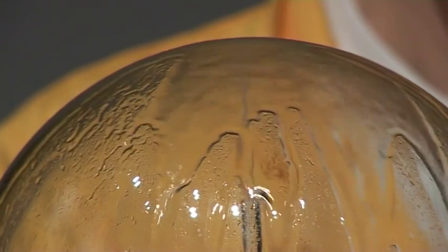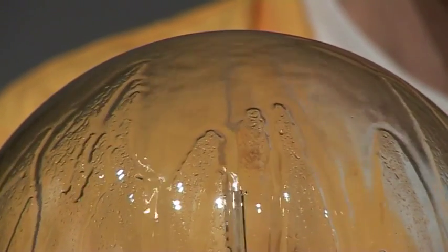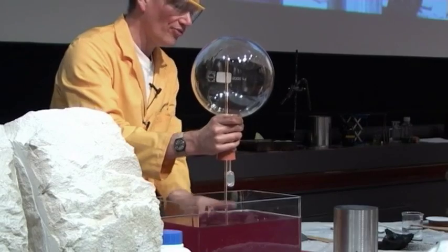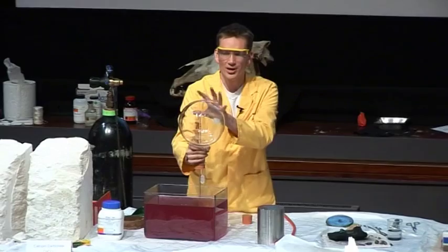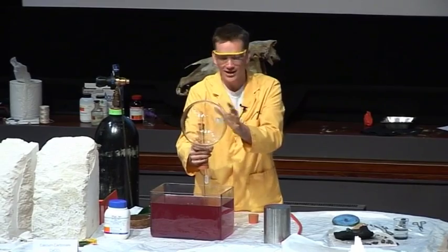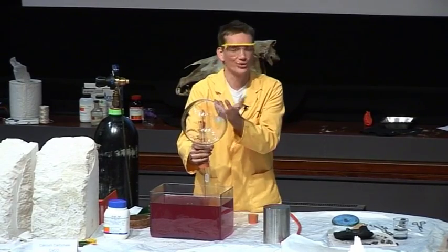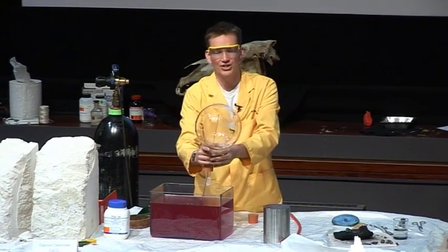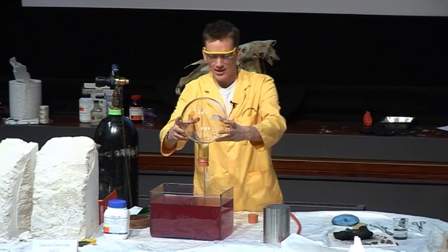Now, as it dissolves, this reduces the pressure inside the flask, which means that more of the water is forced up the tube into the top, which then dissolves the ammonia and so reduces the pressure, and so more water is forced up, and so the water is gradually squirting up into the flask here.